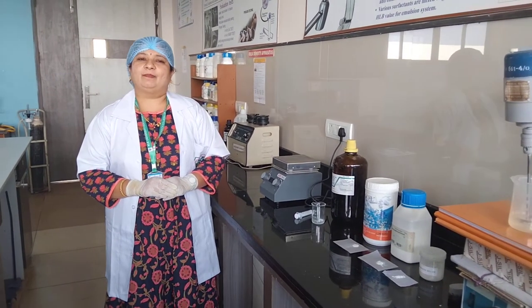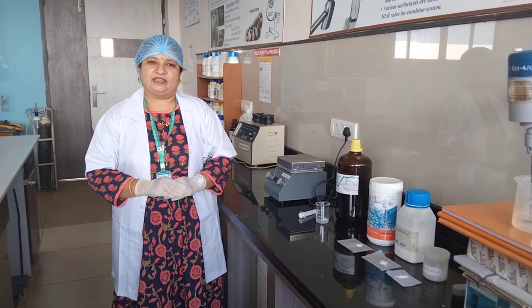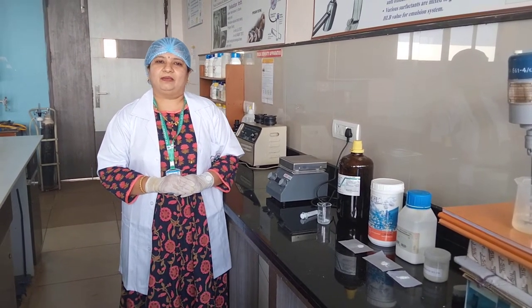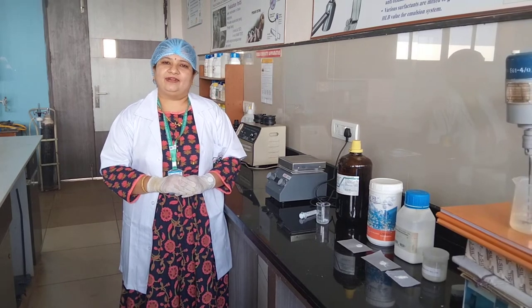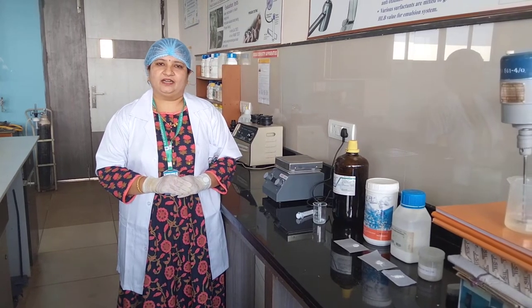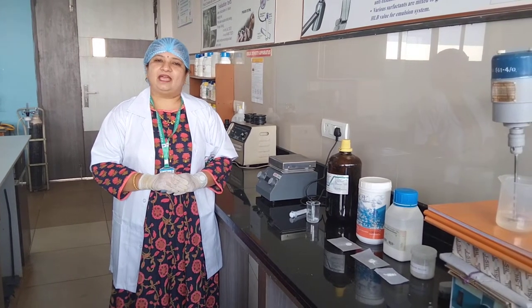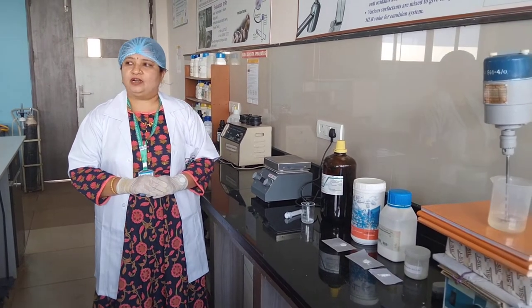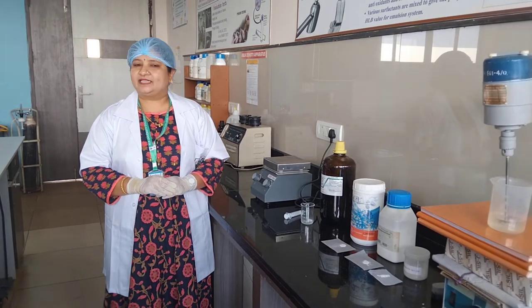Microspheres can be prepared by various methods. Today we will be preparing them using the solvent evaporation method, which is economical and can also be used for commercialization.